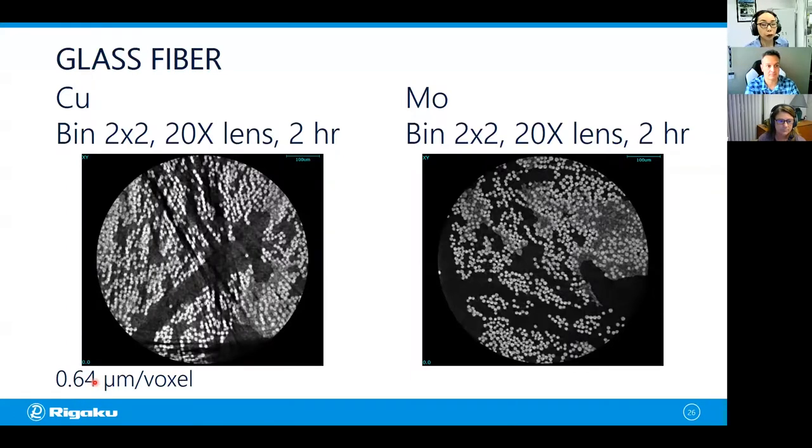You get great contrast. The glass fibers look very, very bright and everything else is very, very dark, which is kind of nice, but you see those streaks coming around or from the glass fibers. Those are beam hardening artifacts, and you don't see that when you use molybdenum, 17 keV.